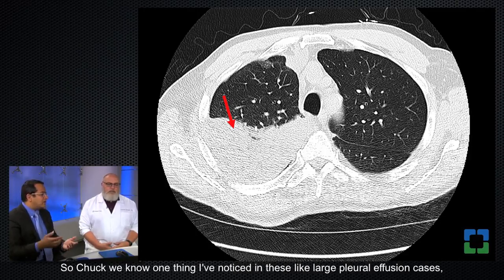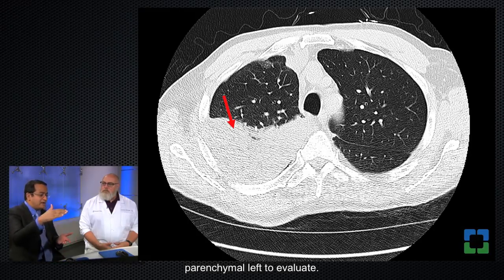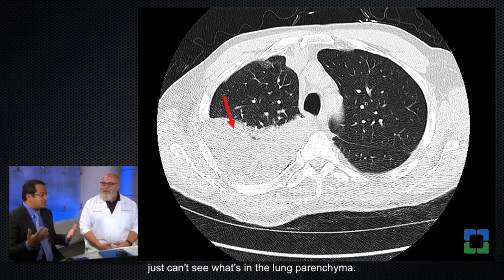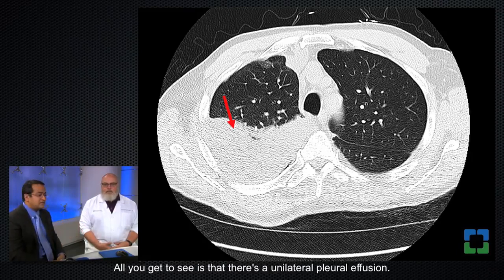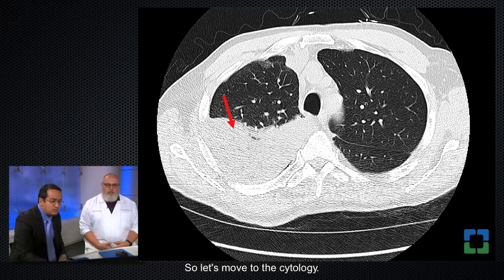That's true. So Chuck, one thing I've noticed in these large pleural effusion cases, especially the unilateral large pleural effusion, is that here you have some lung parenchyma left to evaluate. Sometimes there isn't any. The lung is sort of collapsed completely and you just can't see what's in the lung parenchyma. Or, if you're looking for a rind around the lung, you can't even see that because the whole thing is collapsed. Right. So all you get to see is that there's a unilateral pleural effusion, and you don't have too much useful information from the radiology. So let's move to the cytology.